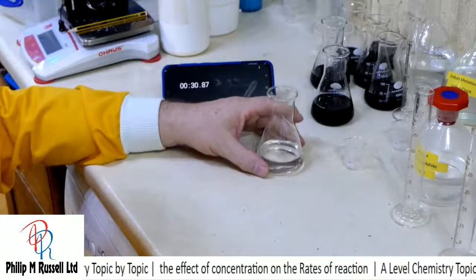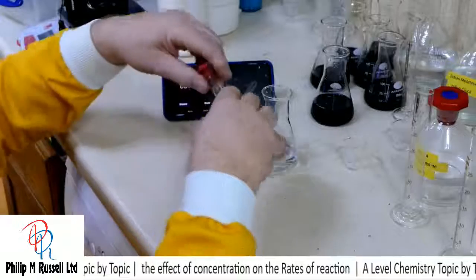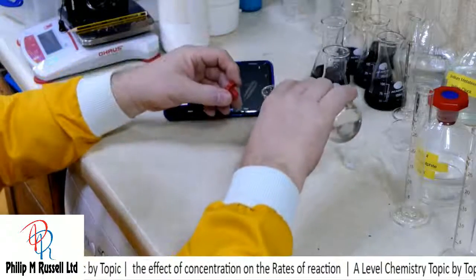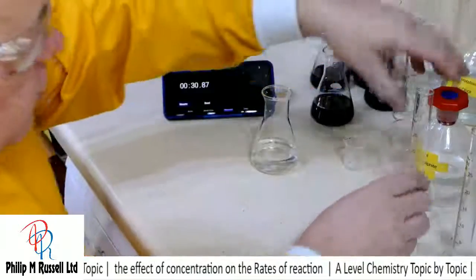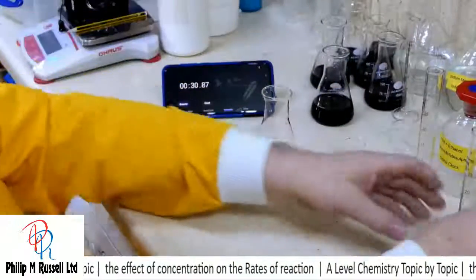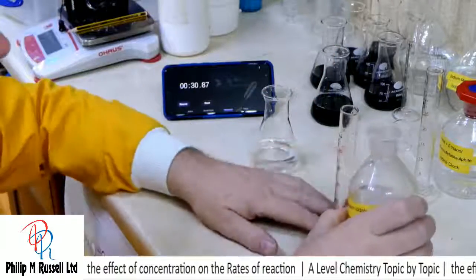So we've got 40 mils of water. Let's put the indicator in. Now this should take quite a bit longer to go, because we're looking at now this as 1/T.